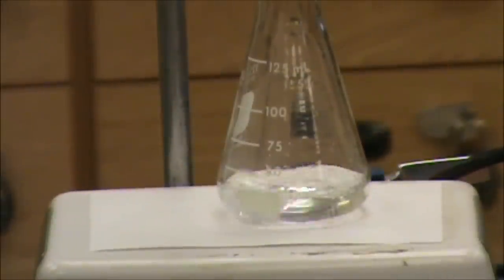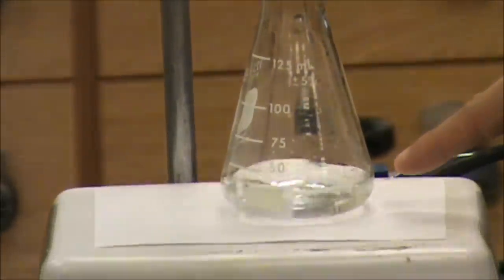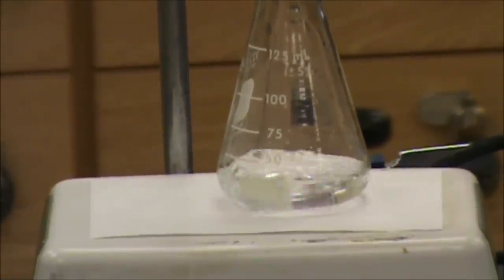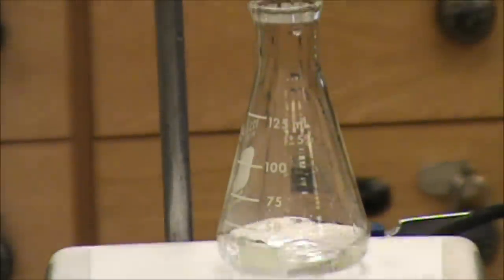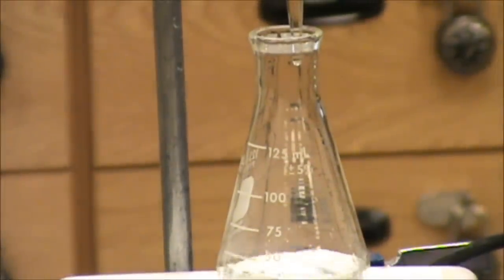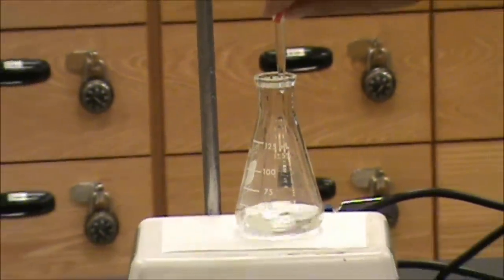We are now closing in on the endpoint. You'll see that these purple splashes of color are starting to linger longer and longer. This means that we want to slow down the addition process because our goal is to pinpoint the endpoint to a single drop of volume.